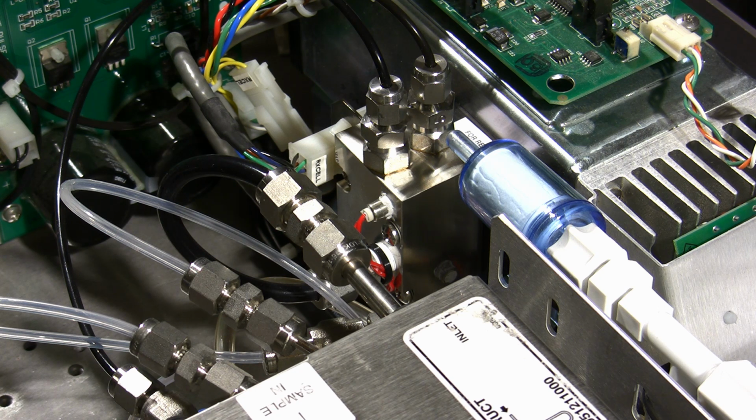If you follow really good procedures while you're doing this, you can typically do this in the field. You can get the thing taken apart, cleaned, and put back together. If you wear good gloves and have the right cleaning materials, within a few hours this thing would typically be stabilized enough that you could run a calibration and get it back online. You may have drift over a couple of days, but it's not going to be drift that's going to put you out of your calibration acceptance criteria.